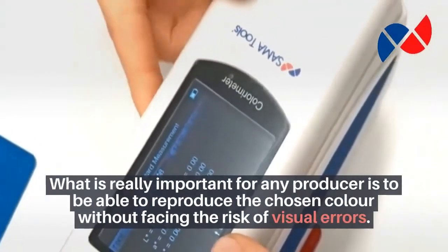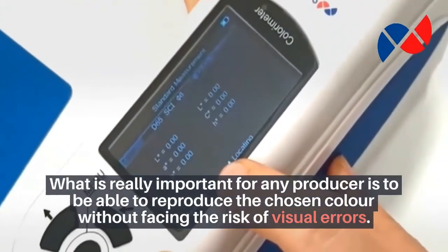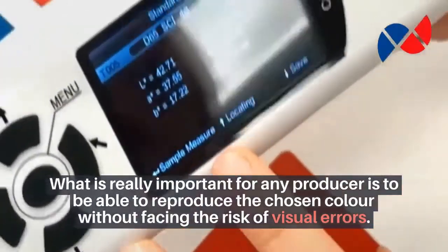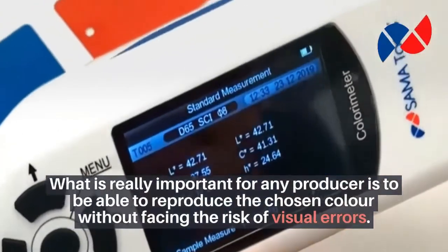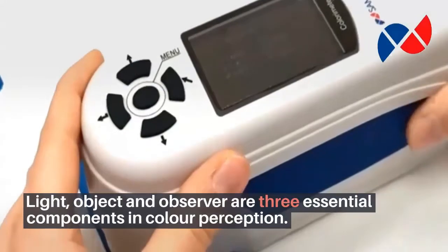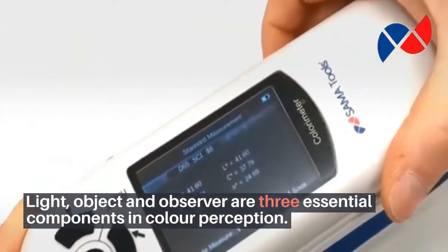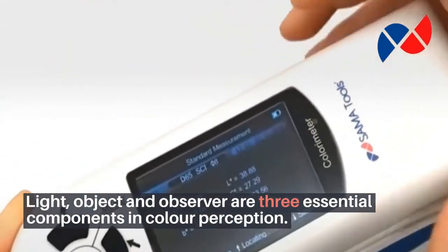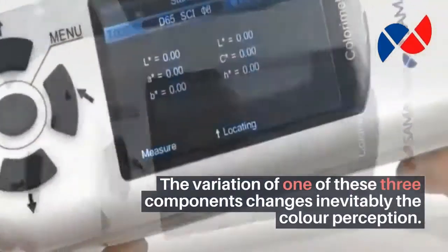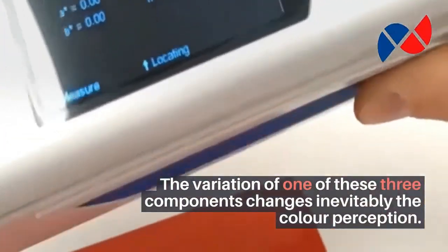What is really important for any producer is to be able to reproduce the chosen color without facing the risk of visual errors. Light, object, and observer are three essential components in color perception. The variation of any one of these three components inevitably changes color perception.